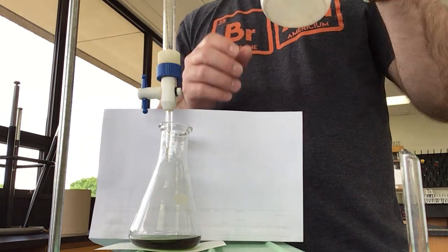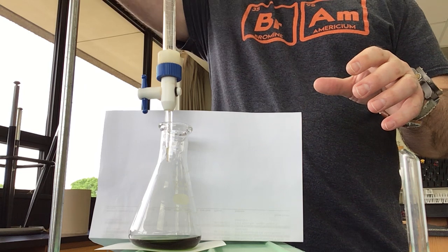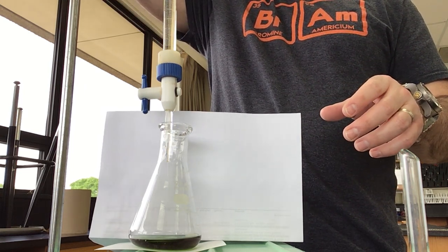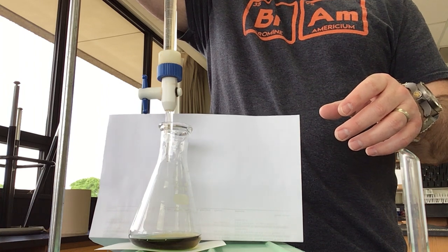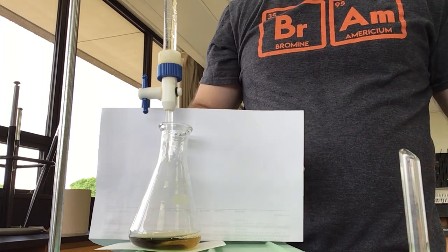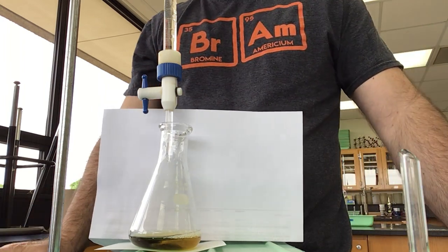I'm going to use my squirt bottle and fill a bunch of water through here. You could also get water, pour it into a beaker and do that.